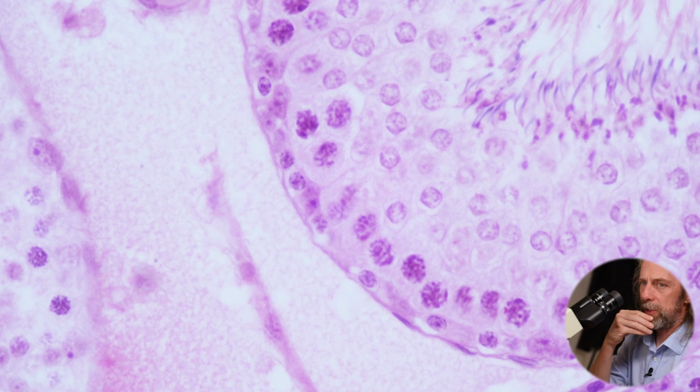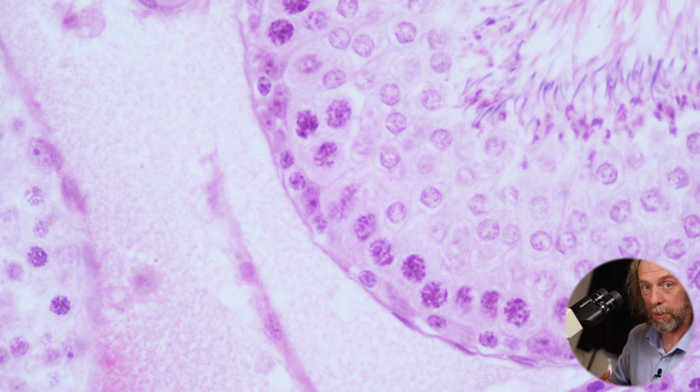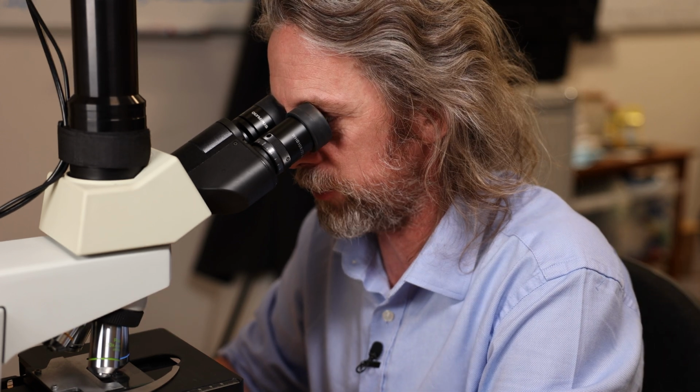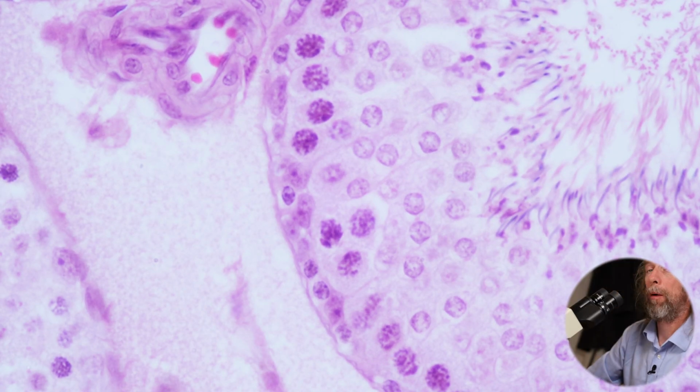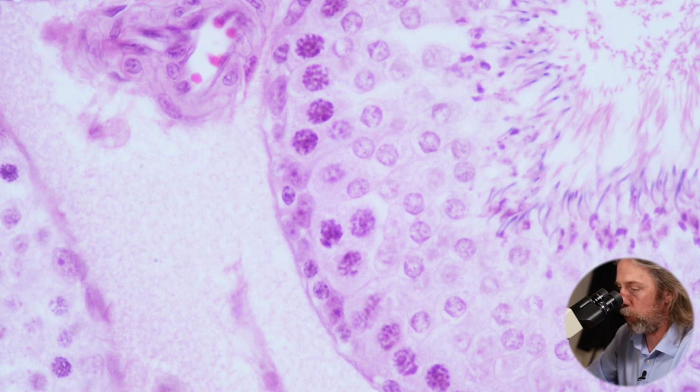So the secondary spermatocytes, these are the cells that are formed after meiosis 1, after the first meiosis cell division from the primary spermatocytes. And that DNA that was in the primary spermatocytes has now split between the two secondary spermatocytes that have formed as a result. So there's less DNA in there. We can see that under the microscope, and these are now haploid cells because they only have one set of chromosomes.